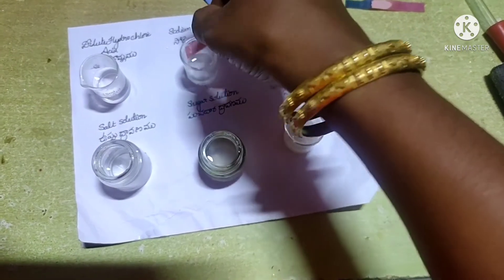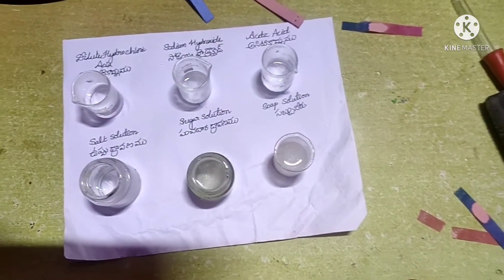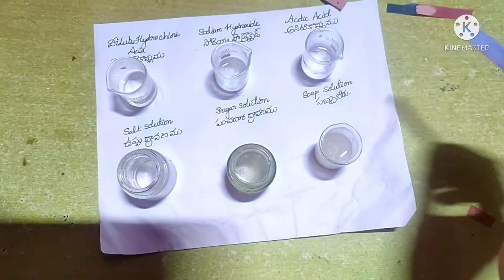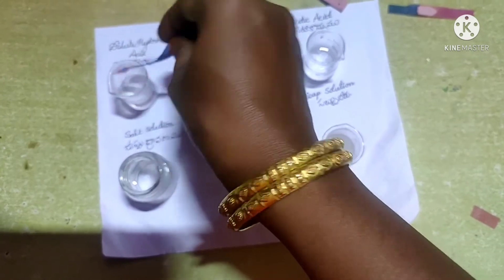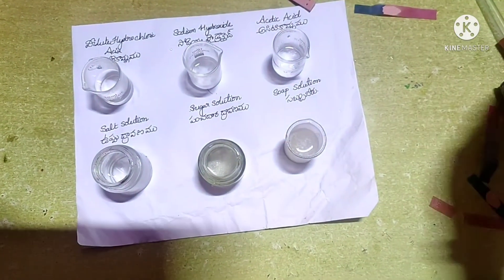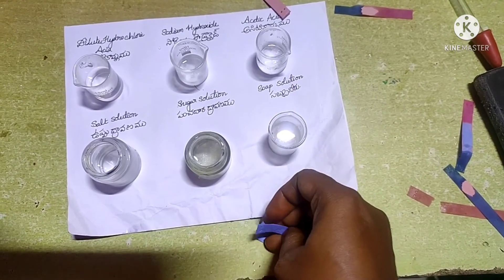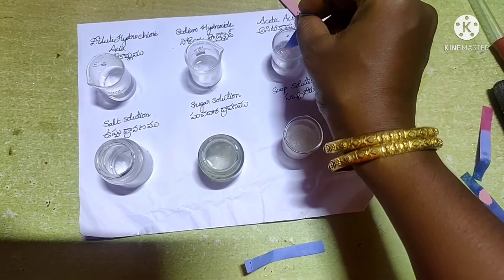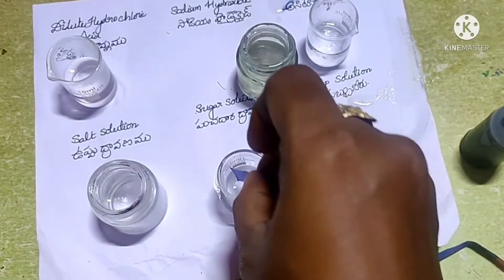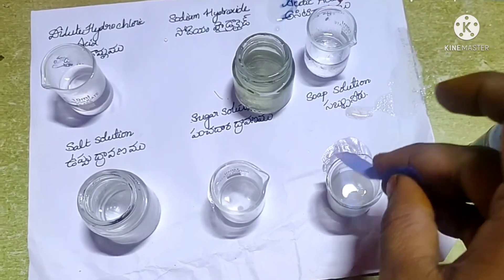Next, take blue litmus paper and observe the color changes. Dip blue litmus paper into dilute hydrochloric acid — it will turn red. Dip blue litmus paper into sodium hydroxide solution — it does not change its color. Take blue litmus paper and dip into acetic acid solution — the paper will turn red. The blue litmus will not change in salt solution and sugar solution because these two are neutral solutions. When dipped into soap solution, it does not change its color.